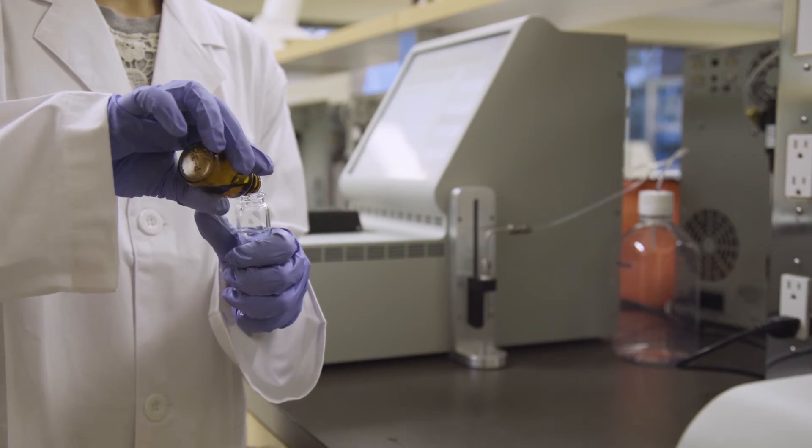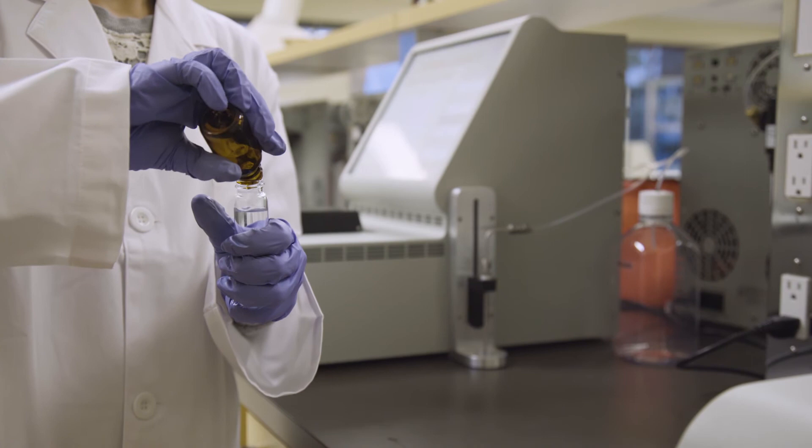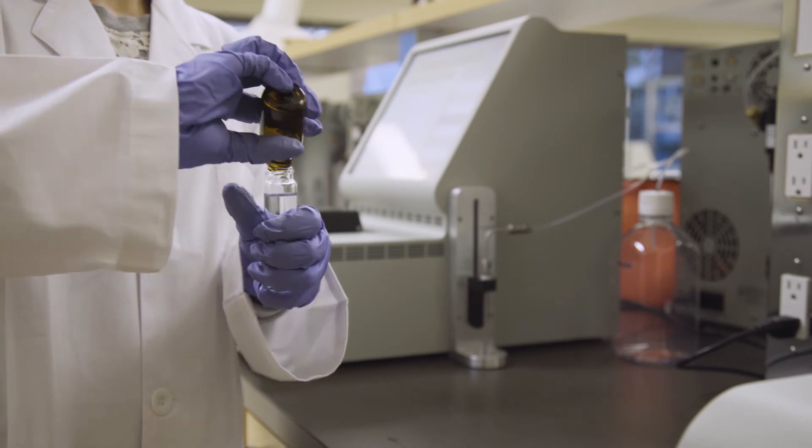To run a test, first fill the vial with sample. For best results, fill the vial to its neck.